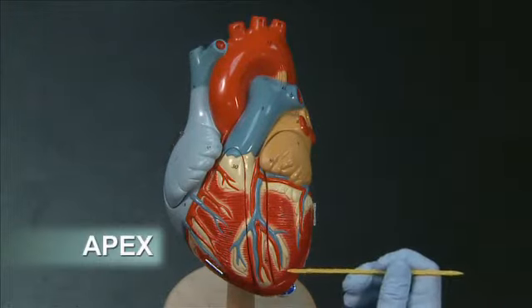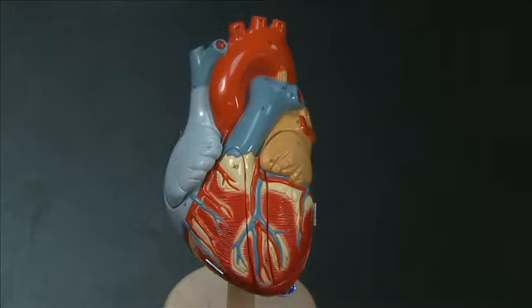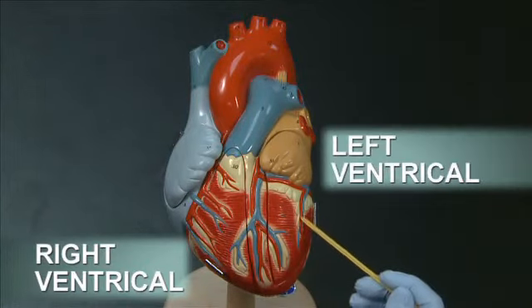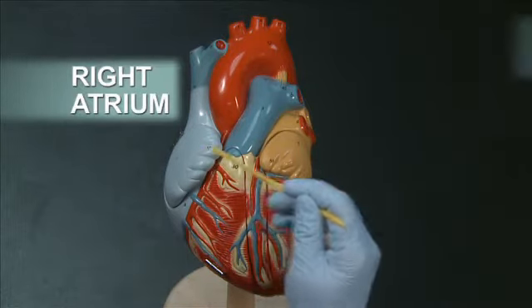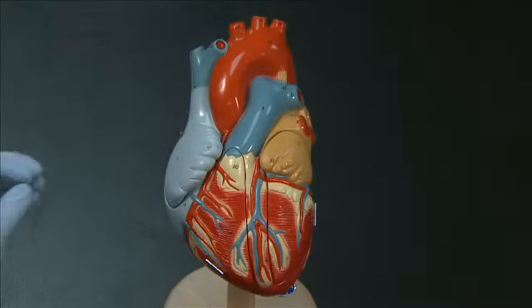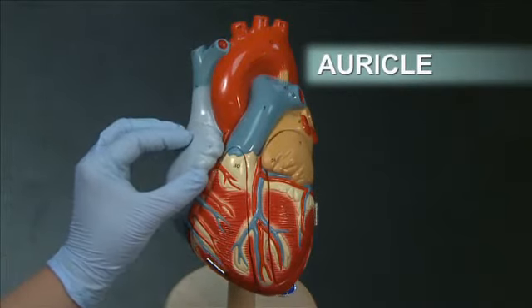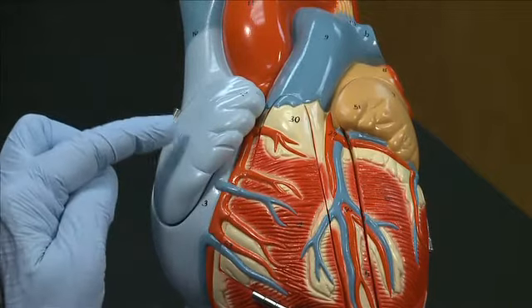The apex of the heart points towards the left. Once you've oriented the heart, you can distinguish the four chambers. The lower chambers are the right ventricle and the left ventricle, and the upper chambers are the right atrium and the left atrium. The external anterior part of each atrium forms a flap-like structure called the auricle, and the term auricle is derived from the word for ear because it looks a little bit like an ear.